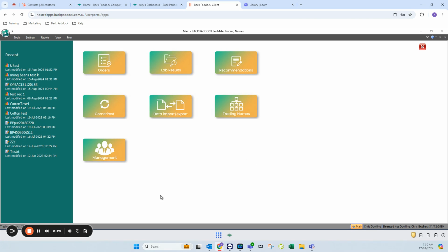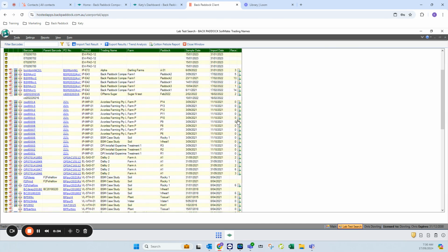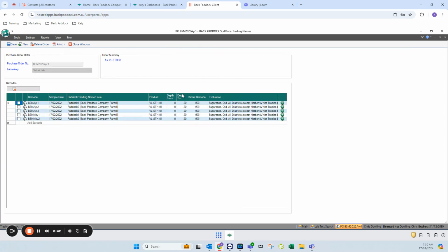So if you open up your SoilMate product, you may be looking at your lab results screen when you notice an issue. And from here or from the order screen, you just need to click into the order that you need to modify. So I'm going to click into this order here and have a look. So in my case, I'm going to say that these first two samples should have been a profile. So I should have had a 0 to 15 and a 15 to 30 matched up. But instead, I've accidentally entered them both as a 0 to 20.